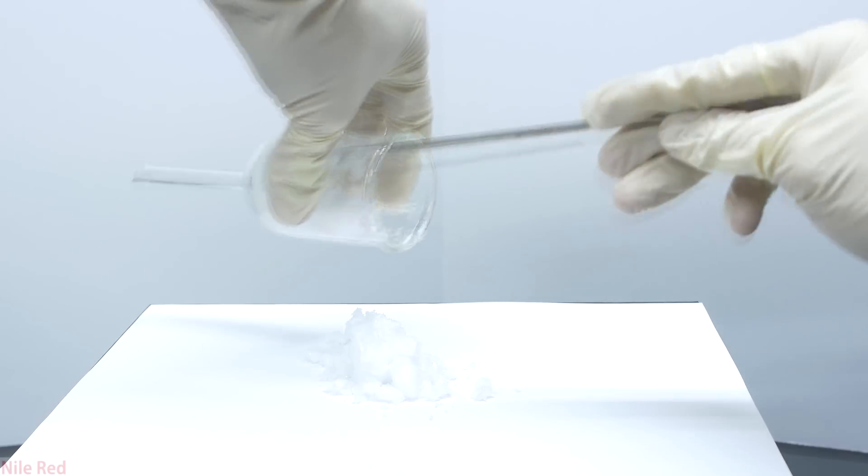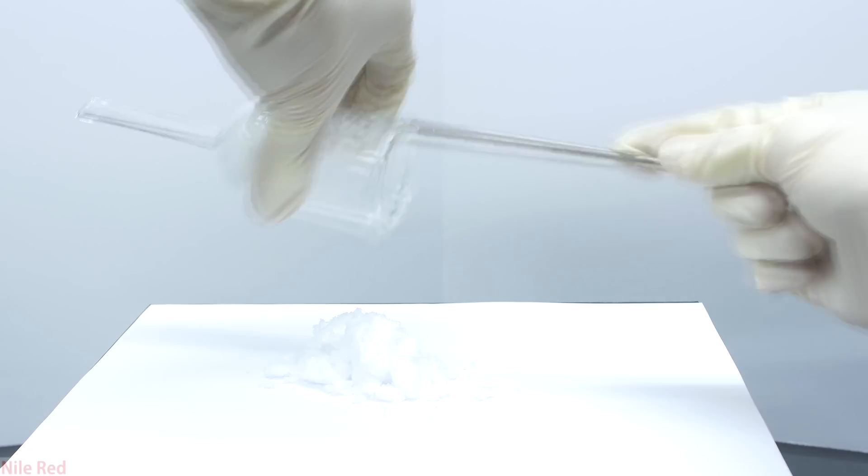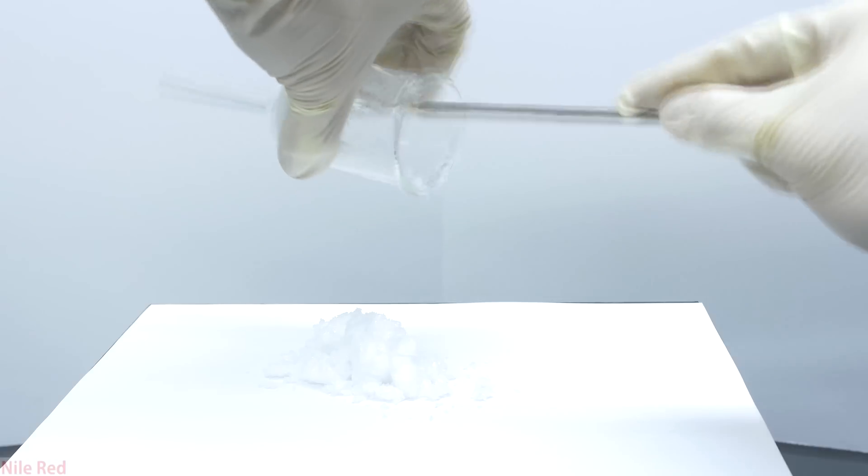The oxalic acid is then scraped out of the filter funnel and onto a piece of paper to dry. By leaving it out for something like a day in open air, it actually dries up pretty nicely.